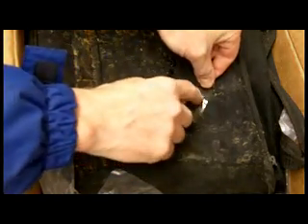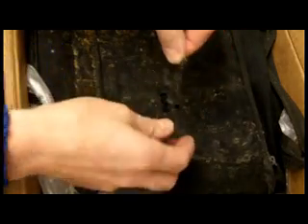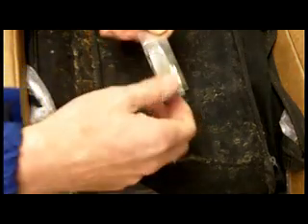Place a 3M clear scotch tape onto the surface to be sampled and then place the tape directly onto a microscope slide. It's often better to have a frosted edge on the end of the microscope slide so it can be labeled.